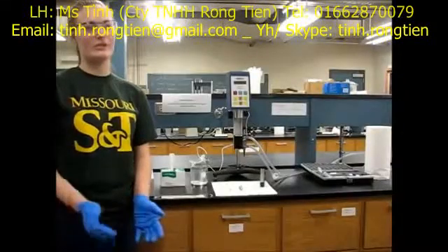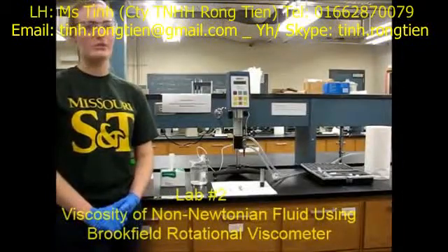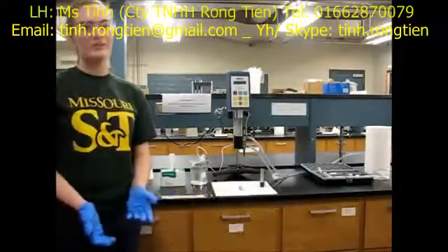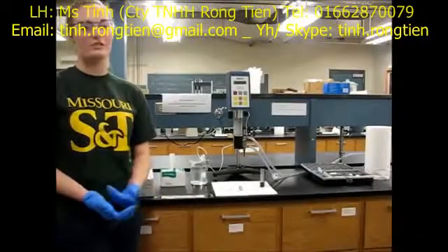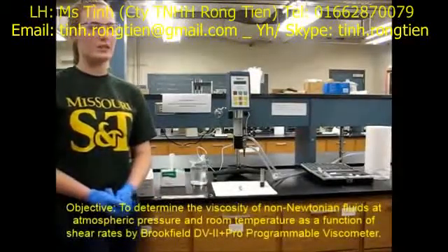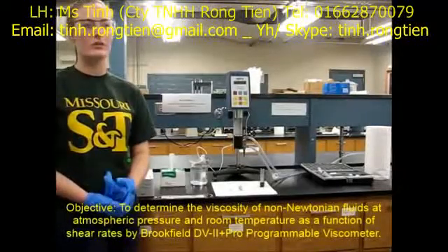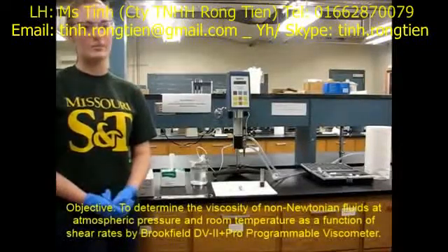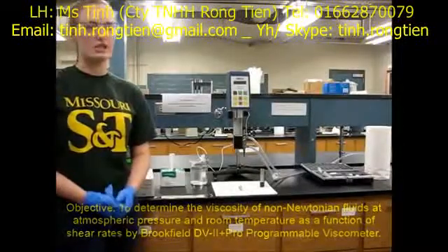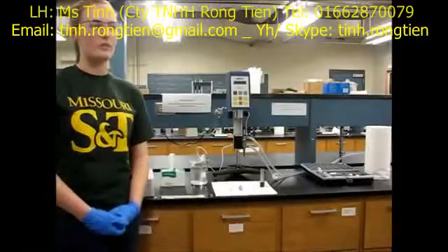Welcome to Lab 2: Viscosity of Non-Newtonian Fluid using the Brookfield Rotational Viscometer. As we know, fluid viscosity is defined as the internal resistance to fluid flow. The objective of Lab 2 is to determine the viscosity of a non-Newtonian fluid at atmospheric pressure and room temperature as a function of shear rates using the Brookfield Programmable Viscometer.